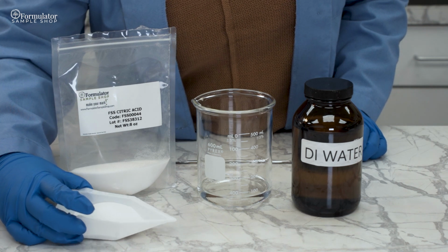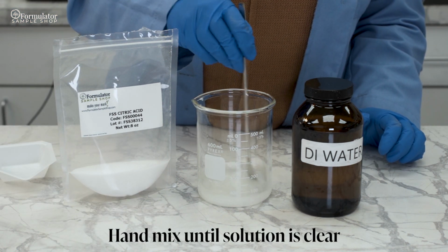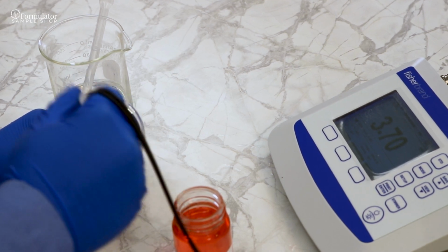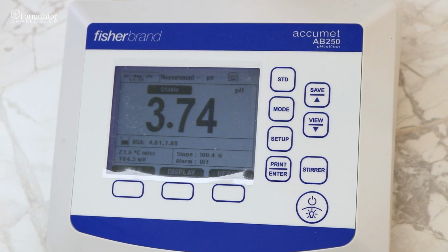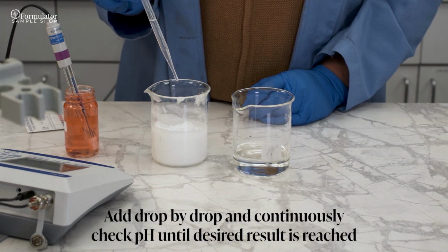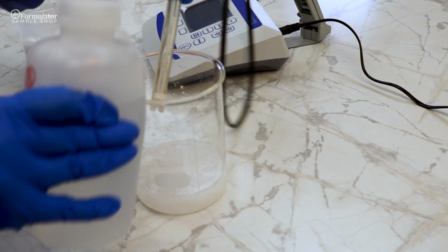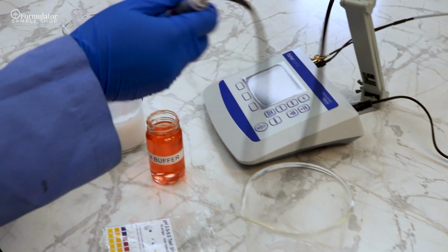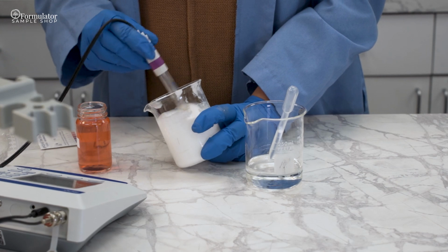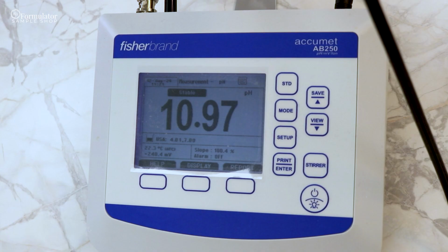If we wanted to lower the pH, we would do this by using citric acid. Just like we tested the pH prior, we will do the same to see where our pH has landed. However, if we wanted to raise the pH, we would do this by using NaOH 50%. Again, we are just going to check the final pH to make sure it has landed where we want it. Remember to always write down the pH of your formula in your lab book.